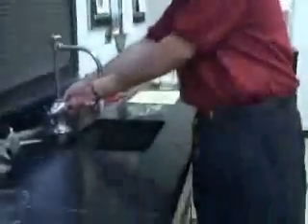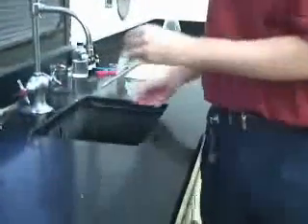Phenolphthalein is a pH indicator, so it changes color when the pH changes. So I'm going to add phenolphthalein inside our dialysis membrane. So I've got a pH indicator inside the membrane, and I'm going to place my dialysis membrane inside our basic water. We're going to look for a color change because we want to decide what can fit through the membrane.